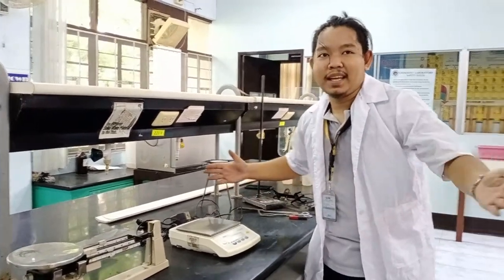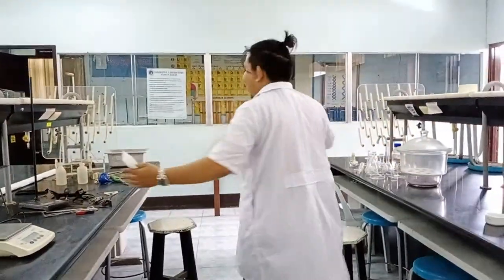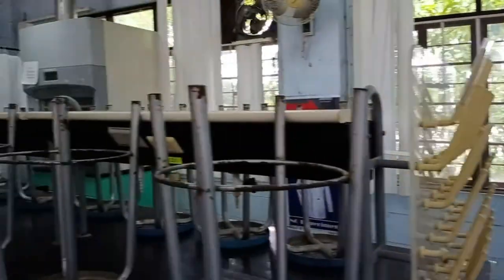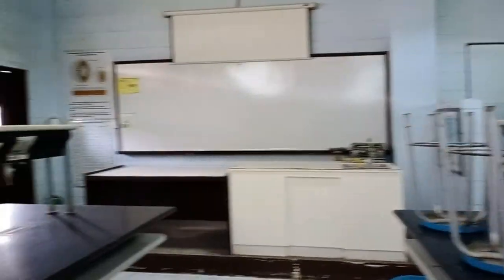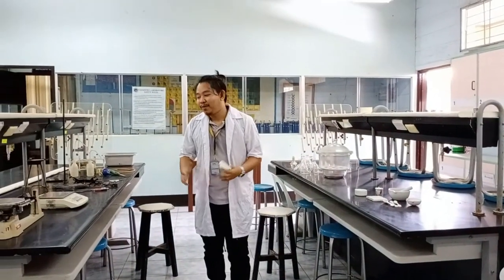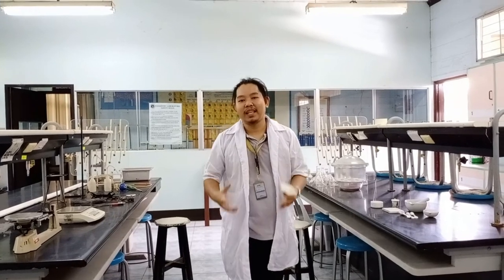So there we have it. Hopefully this helped you get familiar with the different laboratory apparatuses. Since you're not here in person, hopefully this video helped you a little. Again, getting familiar with the different appropriate apparatuses. This has been Sardzello. Thank you, mga Chimek. Peace out.